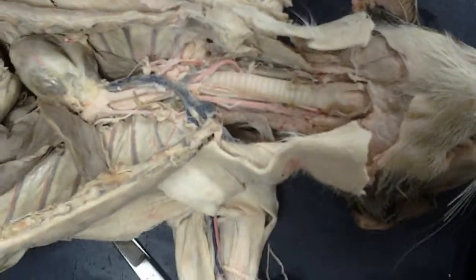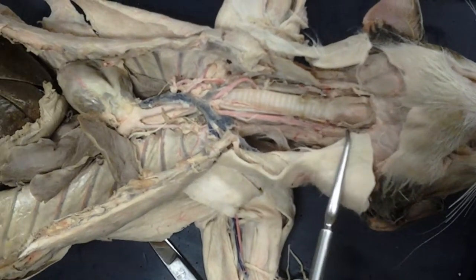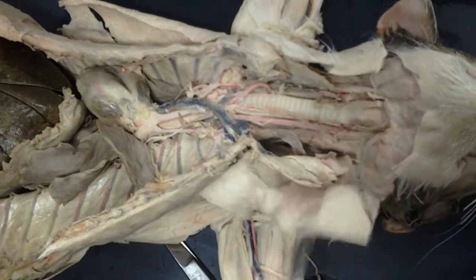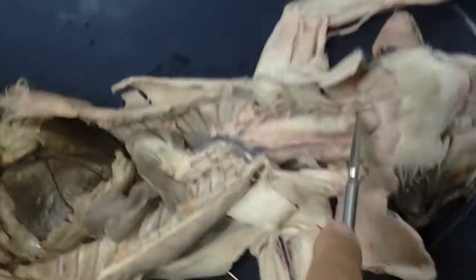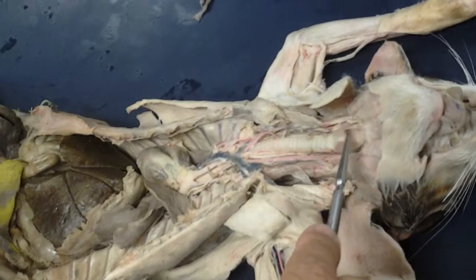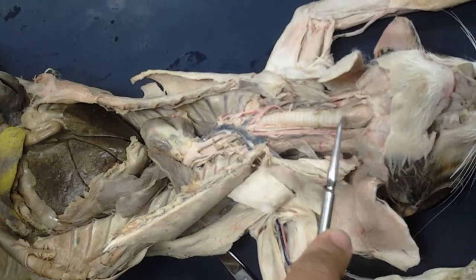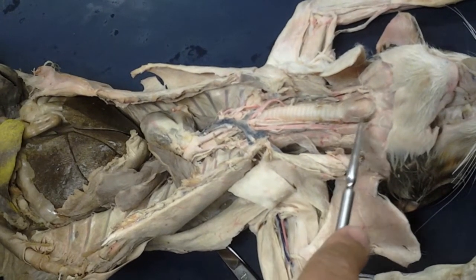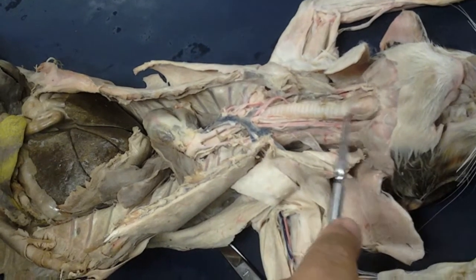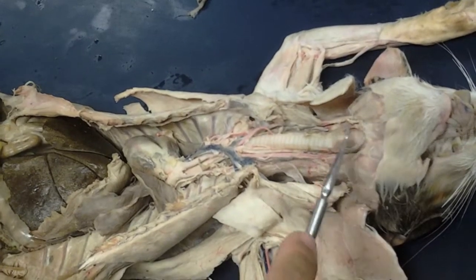Now for the larynx, hopefully you have pictures of all the models that we looked at. Make sure you can identify all of those cartilages. Here on the cat, besides the epiglottal cartilage on the epiglottis, you can see the thyroid cartilage, which is this large cartilage here. And then just caudal to that, you'll have the cricoid cartilage. So thyroid cartilage, cricoid cartilage. This whole structure is the larynx. In humans, it's also known as the voice box. That's where the vocal cords are.